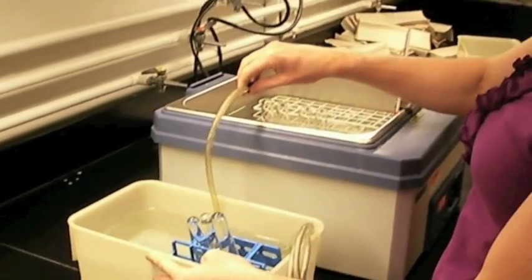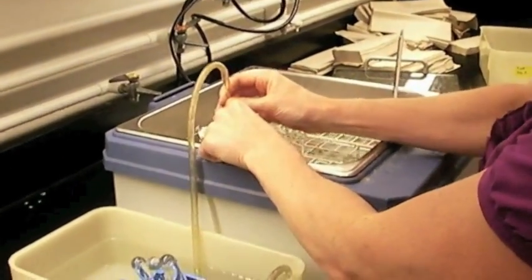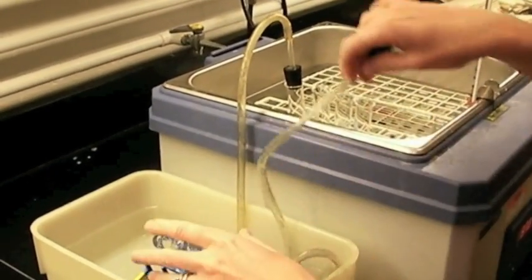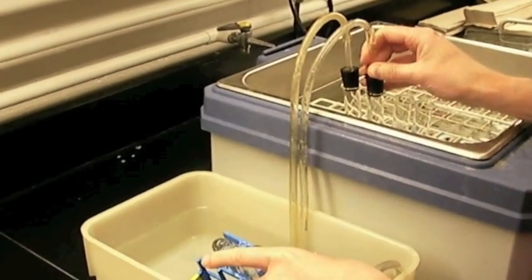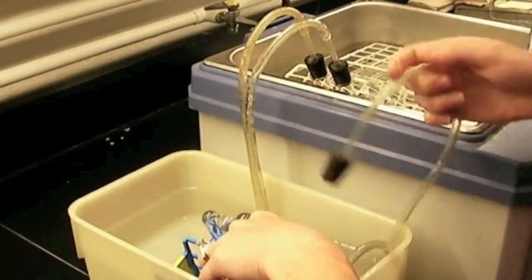And once you add the yeast, you're going to stopper the tube, each individual tube after you add the yeast. And this is where you're probably going to need a couple hands to hold everything.